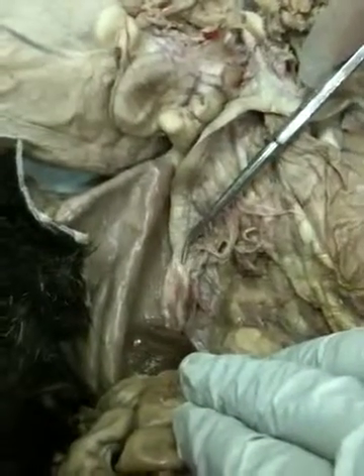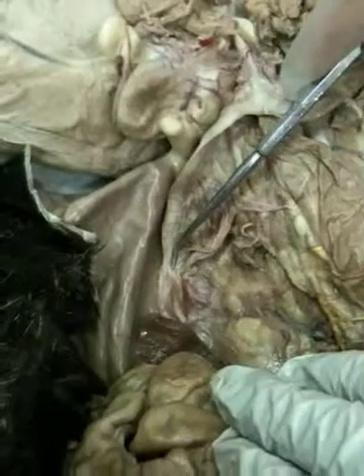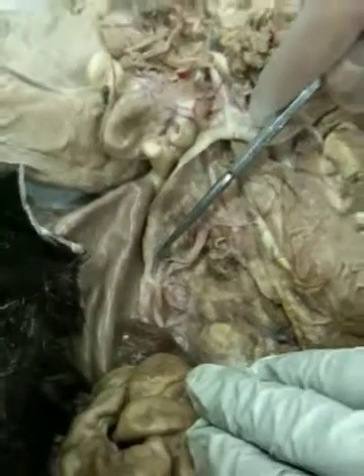The oviduct on a cat is only about that long. Point to the oviduct — the end of the oviduct. Right there. That's the oviduct. Very short on a cat.